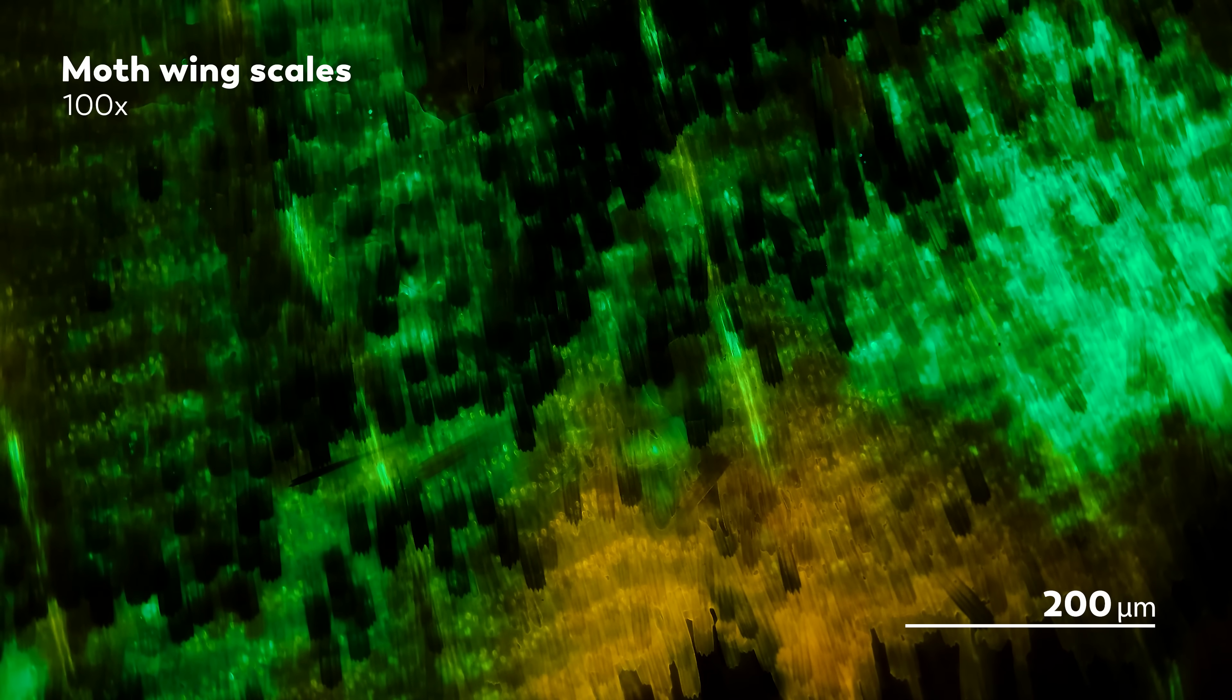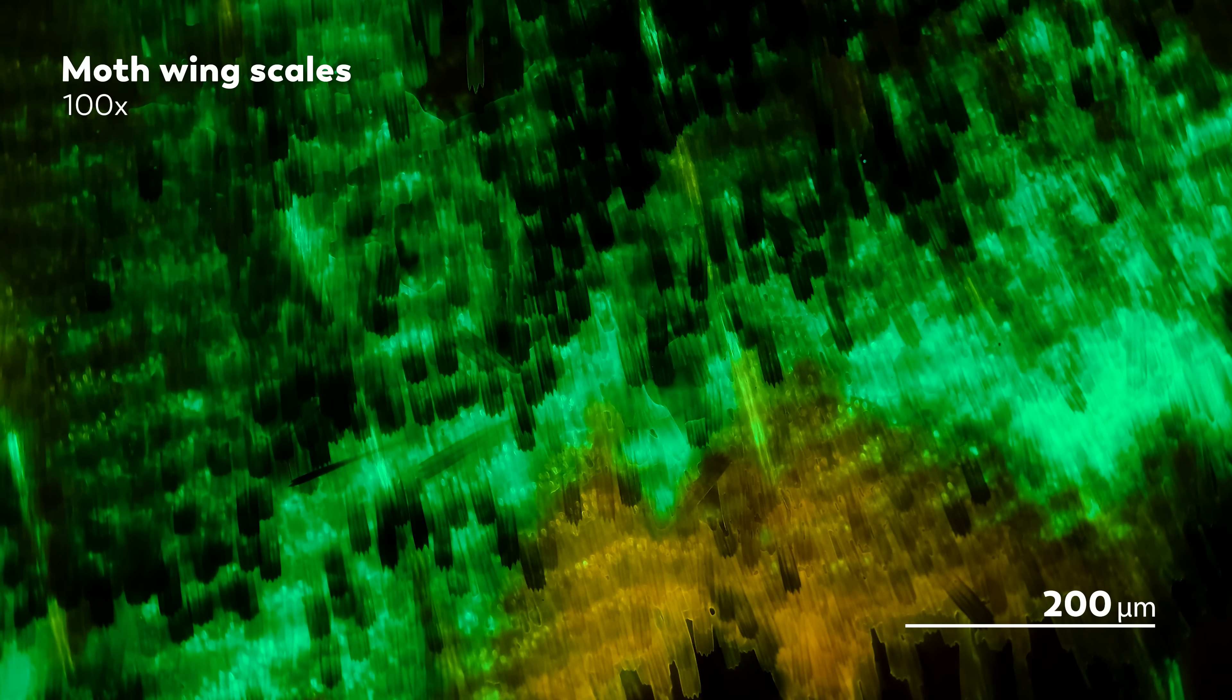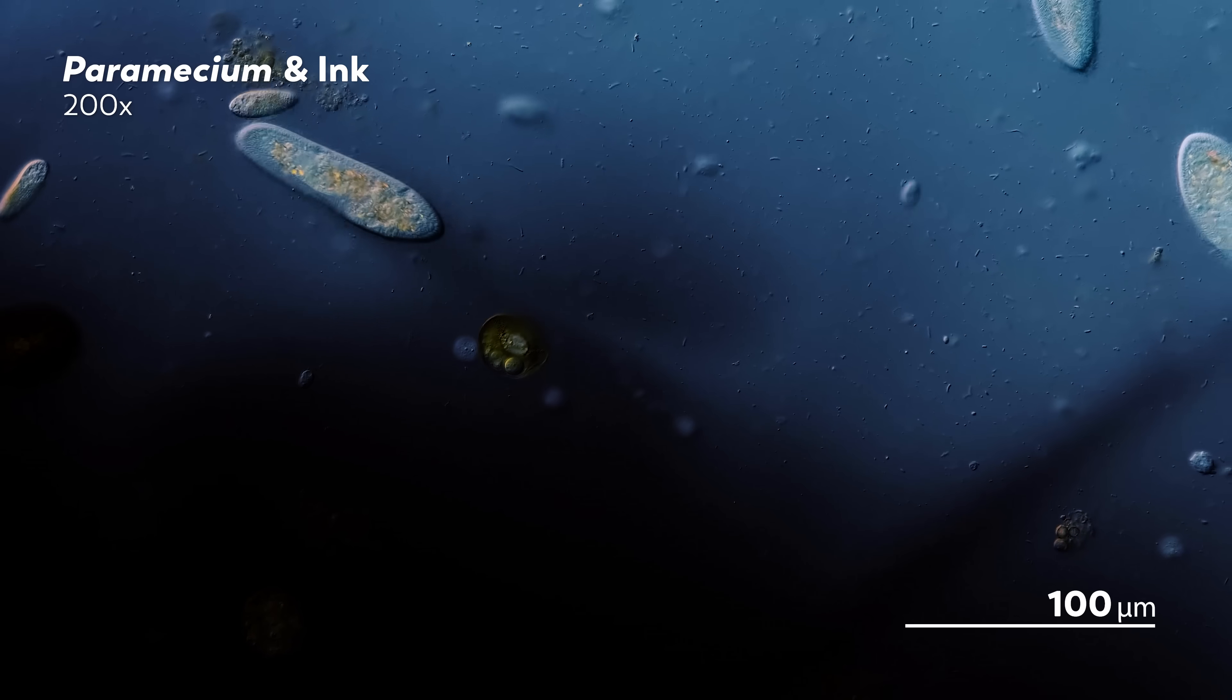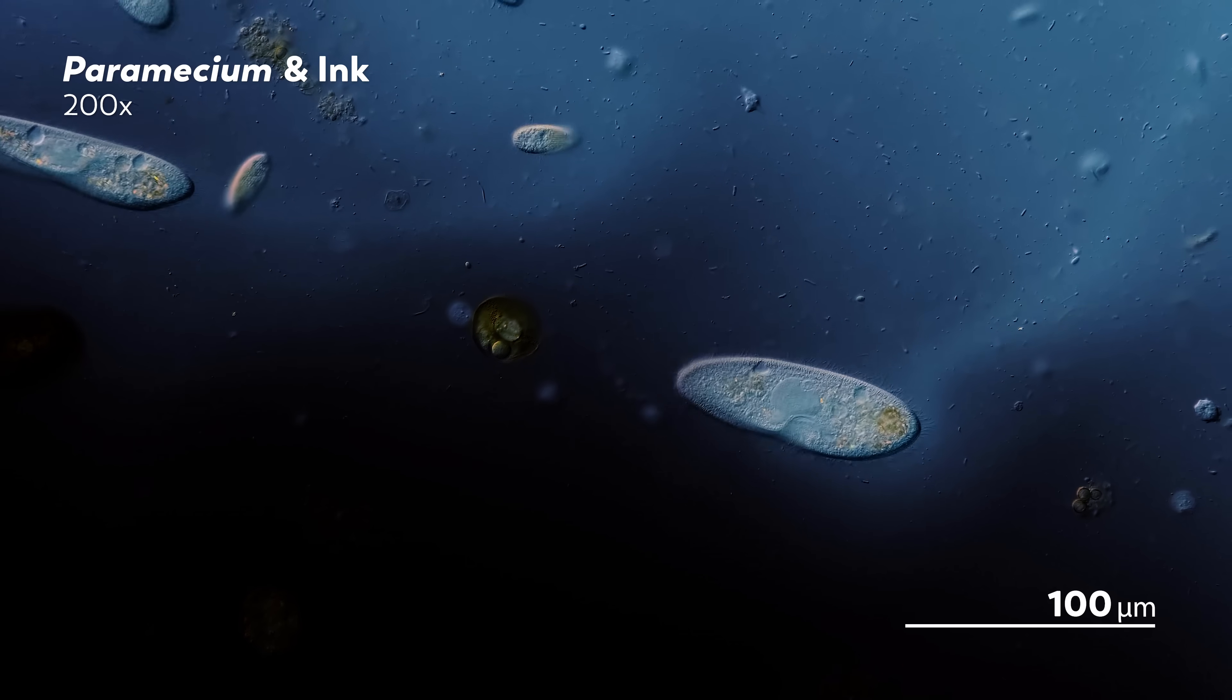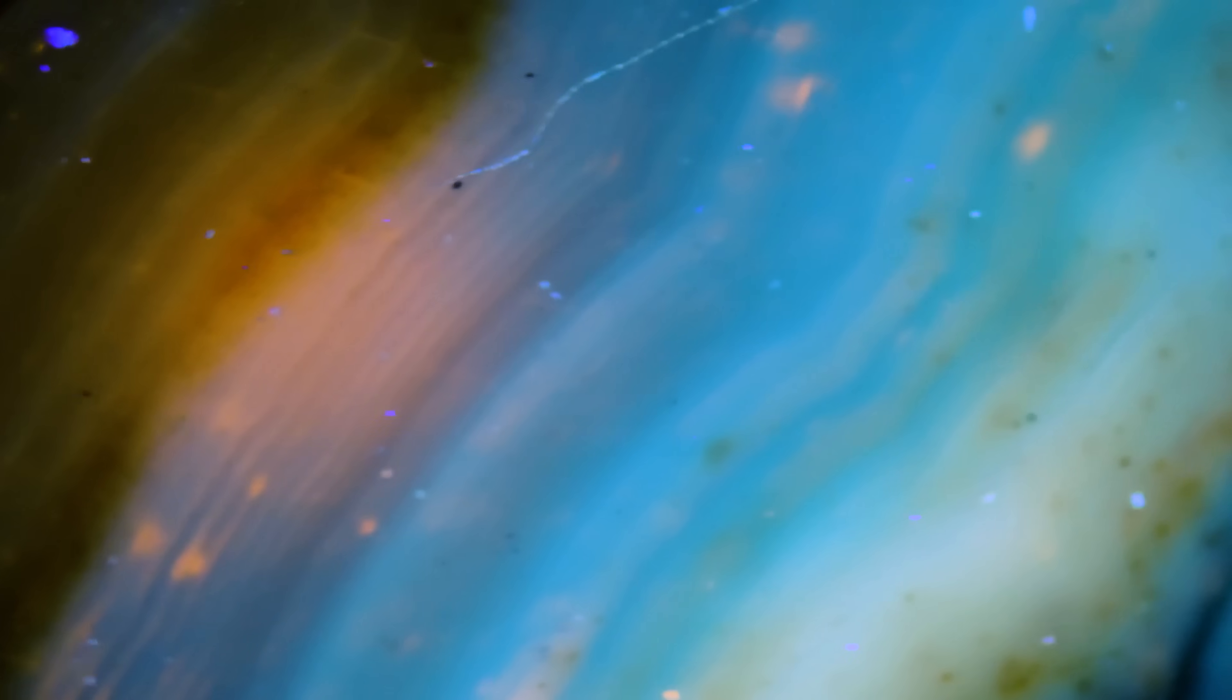He's always on the hunt for new techniques to enhance his microscopy. Sometimes, that has meant big changes, like upgrading his microscope. Other times, that's meant making small changes to the water his organisms live in, like adding ink. But for his next experiment, he's been messing around with the actual slides that he uses to watch his organisms on.